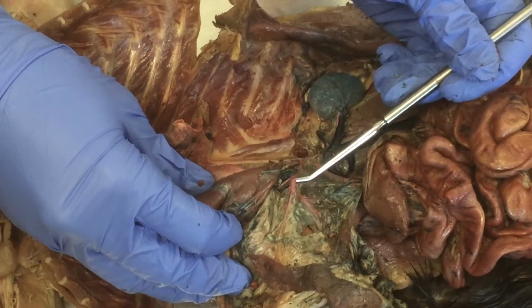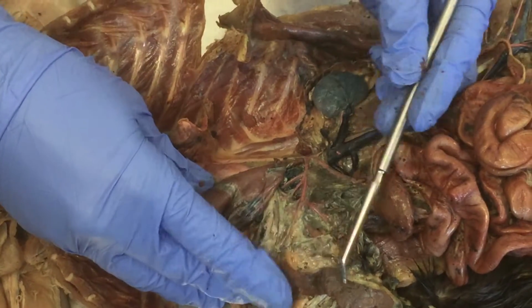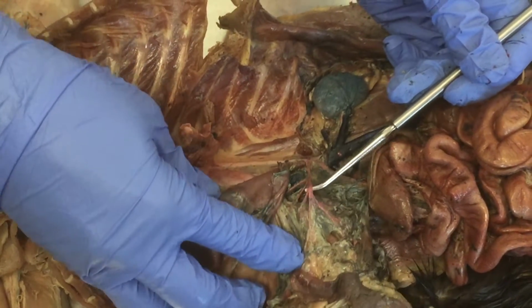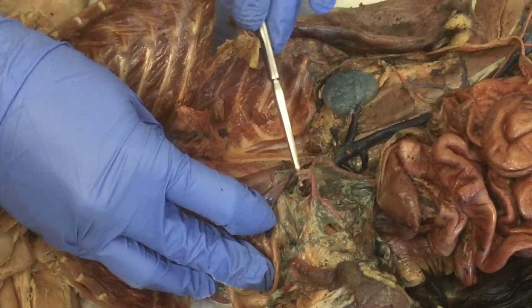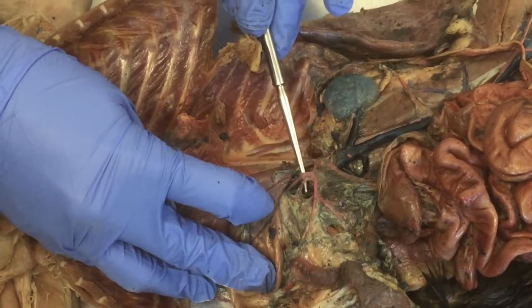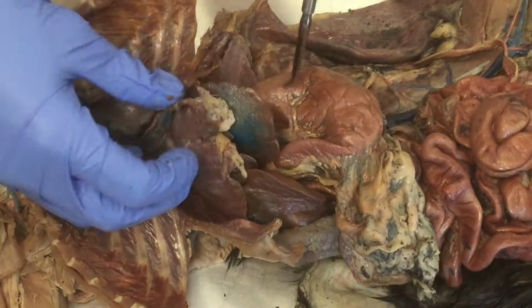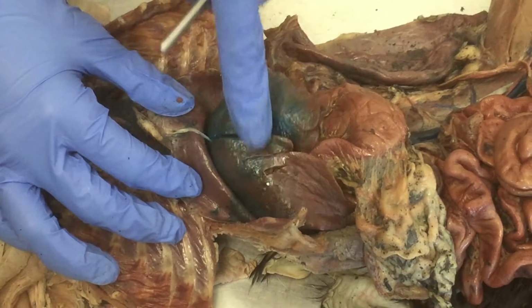So this big branching here is called splenic. Okay, and splenic is going to branch into multiple little branches to feed the whole organ. So it's not going to be just 3 single branches, but here's the main branch, which means the other 2 here have to be hepatic and left gastric. Hepatic is going to go to the what? Liver. To the liver. So hepatic is liver, okay?